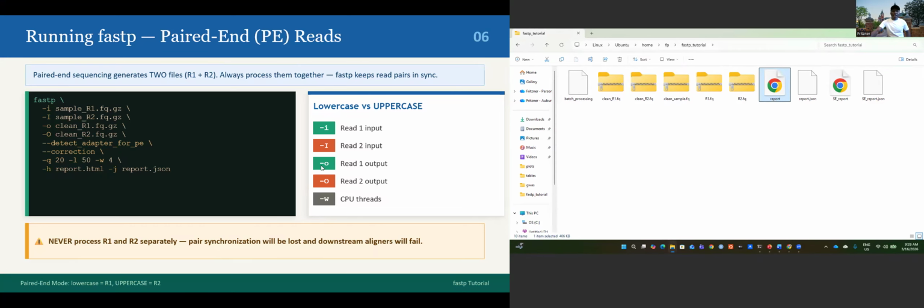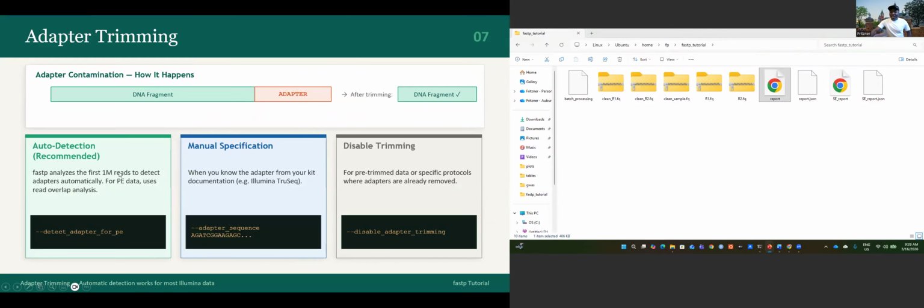Okay, so let's say I just want read one, it just gives you read one. If you want all of the reads, it gives you that, and there's other stuff you can do based on what you are doing. It also gives you the before filtering analysis and after filtering analysis. It's pretty much the same as we did in the single end alignment. Okay. What else can we do?